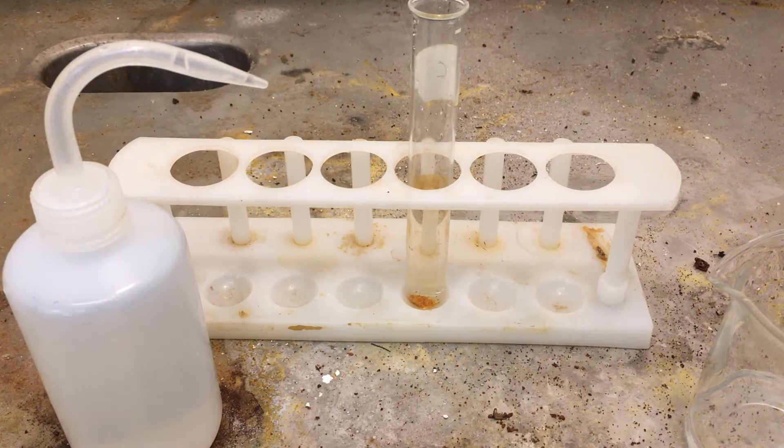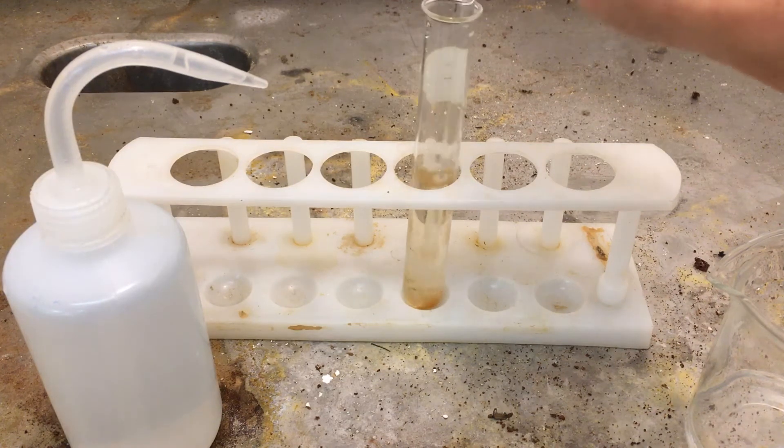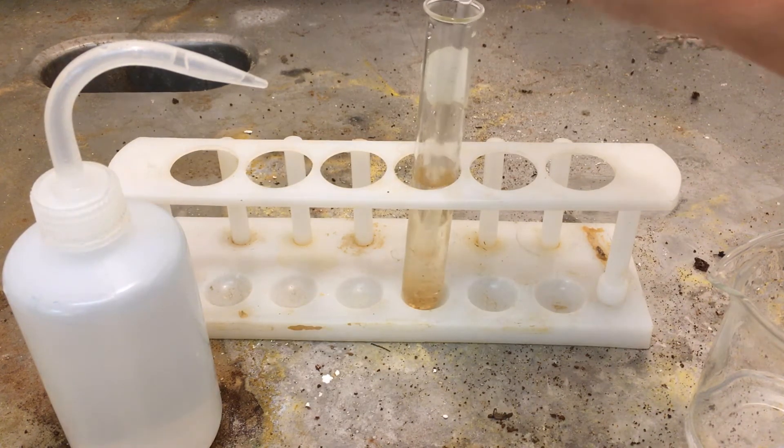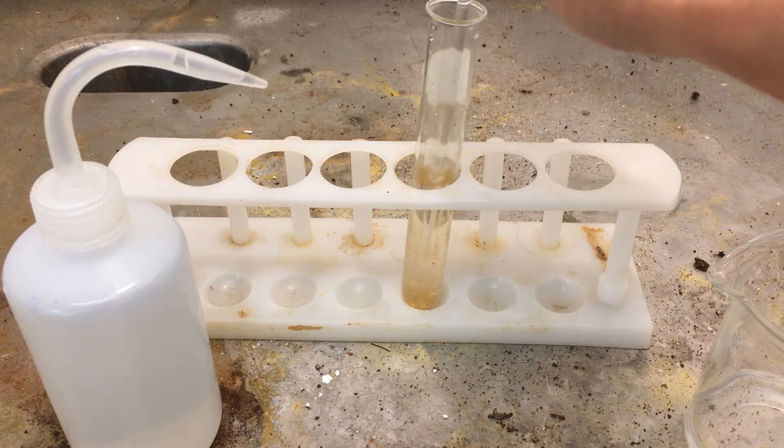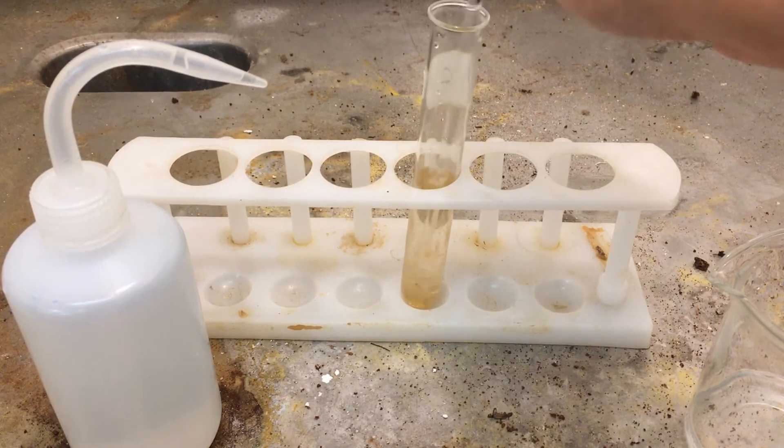I'm going to use a glass stir rod so I can mash up some of the powder. Make sure when you're mashing things inside a test tube you don't poke too hard. Sometimes people actually poke straight through the test tube, and that's not what we want.